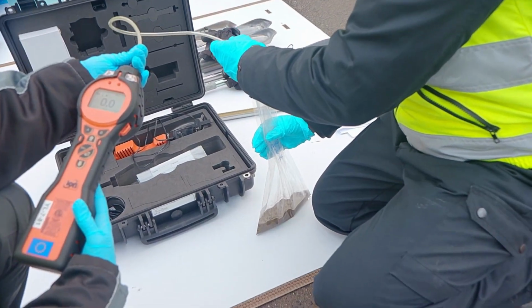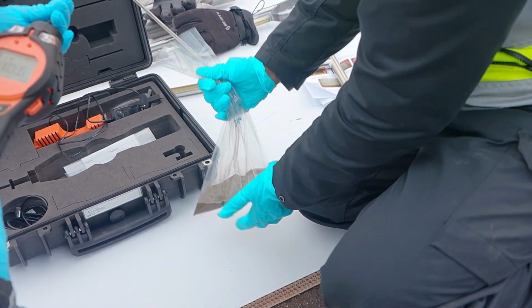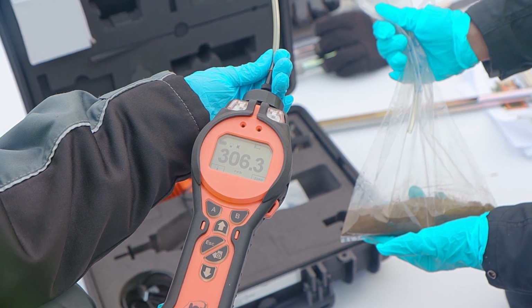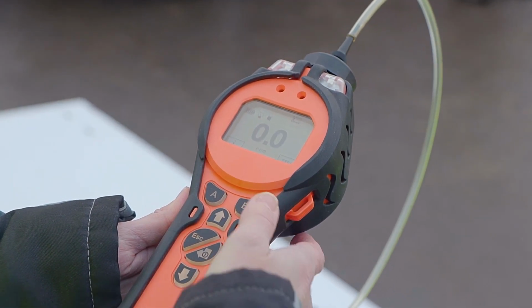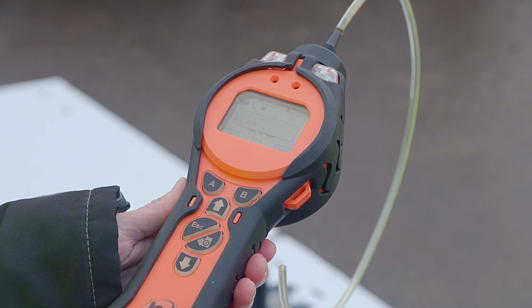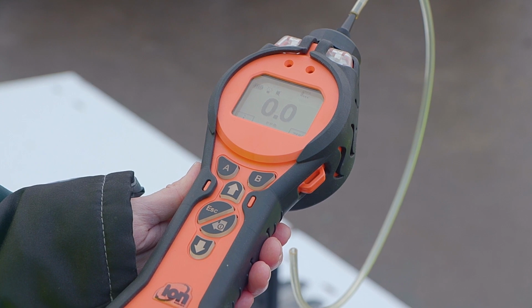The device sucks in the target air in an ionization chamber where UV light turns organic compounds into positive ions. The device recognizes the amount of energy released in ionization and displays it as the concentration in air. The meter is calibrated to two parameters: zero concentration, or the ambient air, and the known concentration of a gas detected by the device. Before use, the device is reset to ambient air or through a special carbon filter.